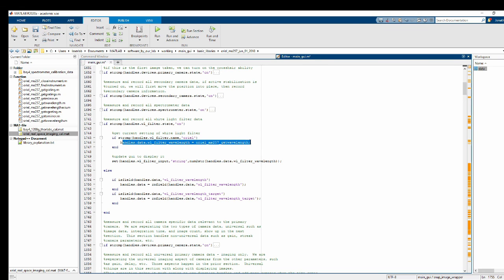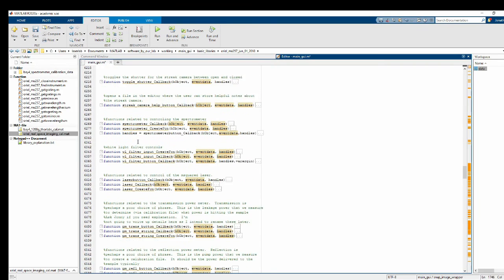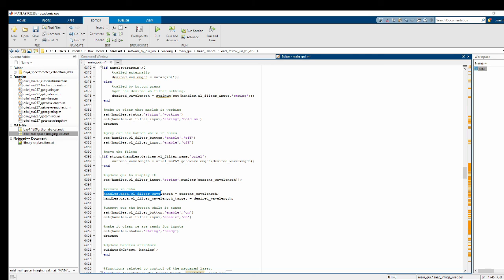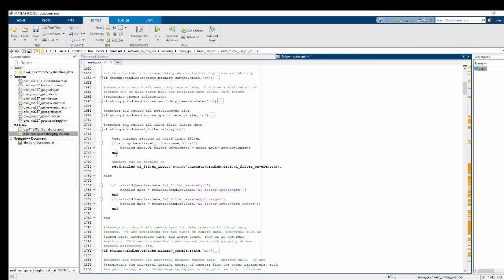And the reason is because there isn't a way to do it. When you request a wavelength, that's the only time that piece of information is around. So you have to record it then and there, which is why we recorded it inside of the previous button. Let me show you that. Somewhere in here. See here, I recorded in my data structure both the current wavelength and the wavelength target. And I have to do that right here because this is when you change the wavelength. So you have to record the target wavelength here. Okay.